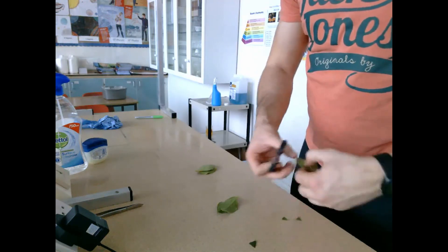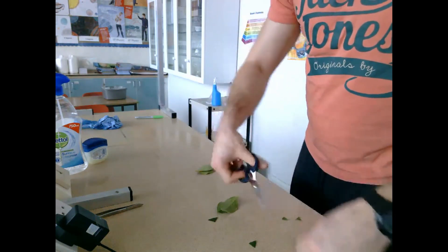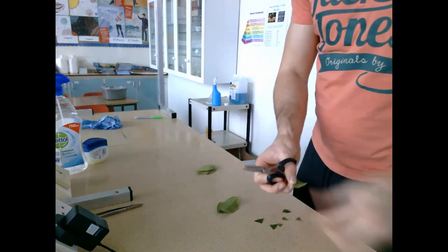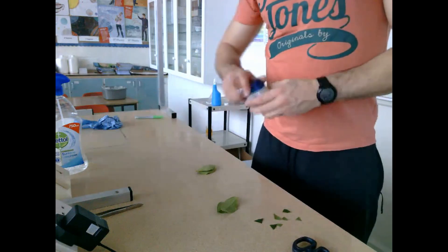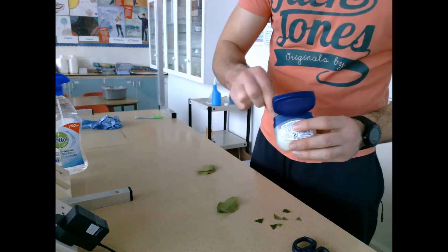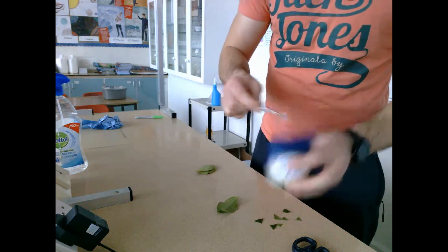What I'm going to do here is use the now-disinfected scissors to start cutting out small pieces of the leaf. I'm using three different leaves again, just to try and increase my chances of getting some leaf yeast. Then I'm going to take some vaseline and put it on the surface of the little sections of leaf.